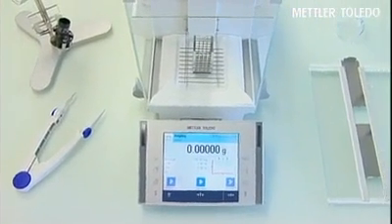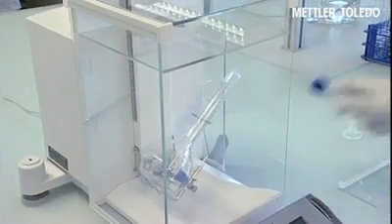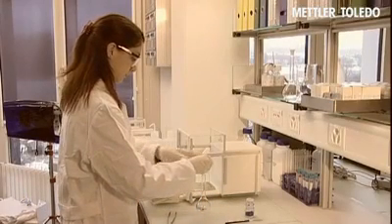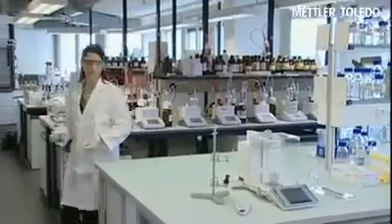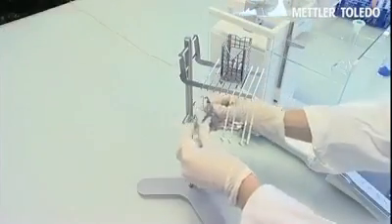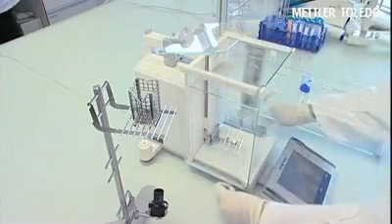METTLER TOLEDO is the market leader in providing innovative weighing solutions, such as ErgoClips for direct weighing into flasks. Commonly practiced weighing procedures using weighing boats often result in undetectable sample loss and have an increased risk of cross-contamination. With ErgoClips sample holders, METTLER TOLEDO provides versatile and easy-to-handle solutions, coupled with maximum weighing accuracy.